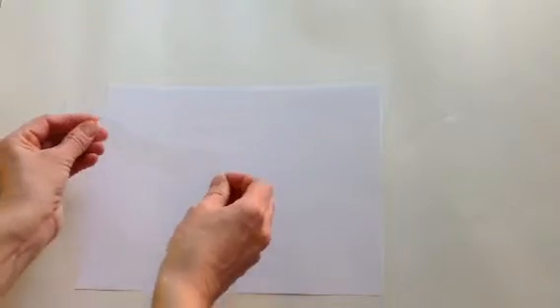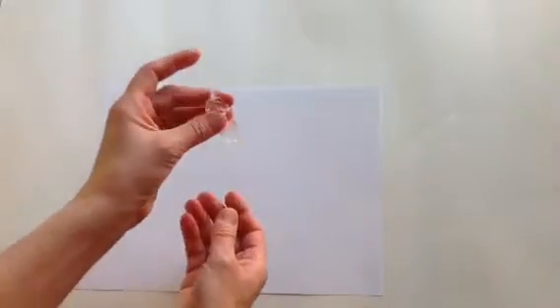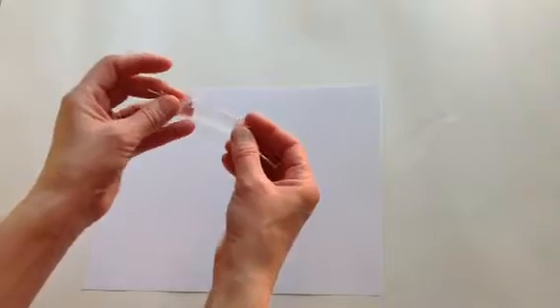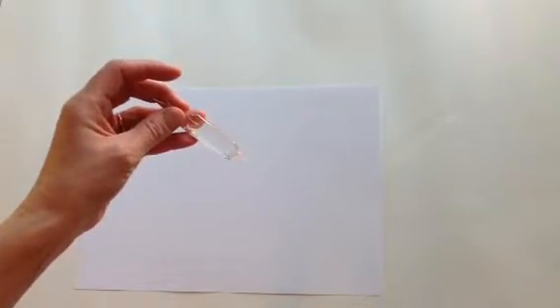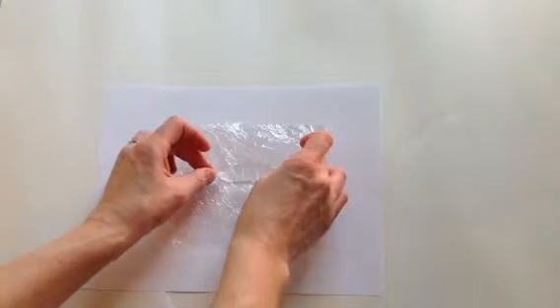So for ease of presentation, I went ahead and made one of those simulated cells. So this is what it looks like. You can see that it's got some string on the end and the cell itself is all filled up. So for us to be able to take a look at the medications, I'm going to just set this on a piece of plastic wrap.